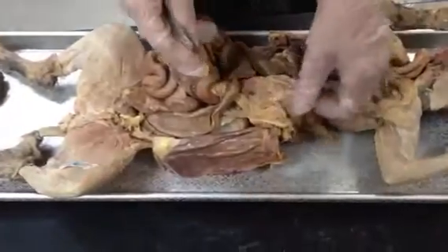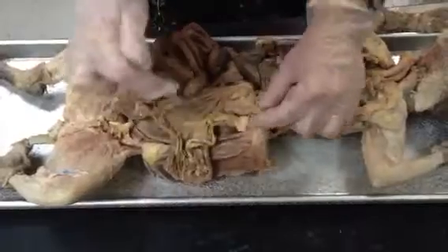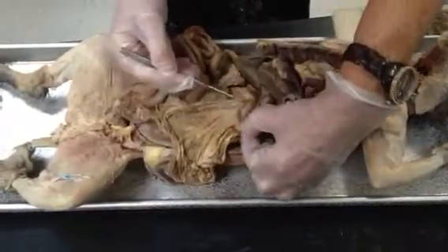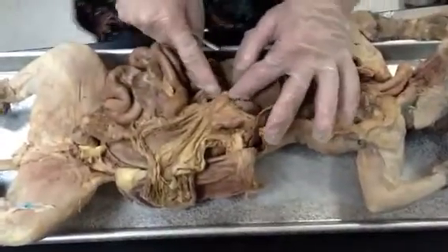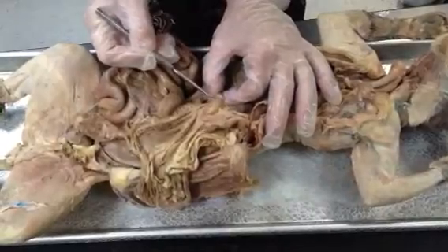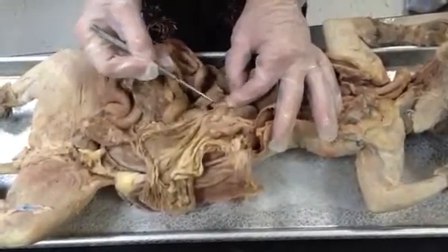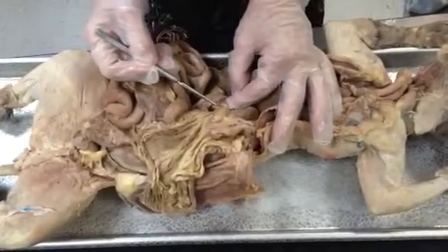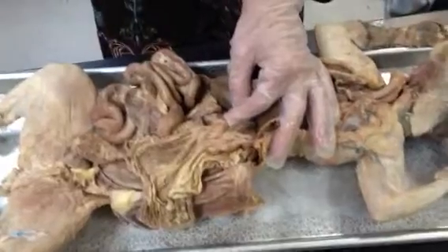The duodenum is going to be the first section of the small intestine. So you find the stomach, you can see where you have your J shape. See that little pinching in, you got a little bit of dense connective tissue there. That's the beginning of the duodenum right there. Into the stomach's J, you'll see that pyloric sphincter, and then that's the duodenum. Okay.